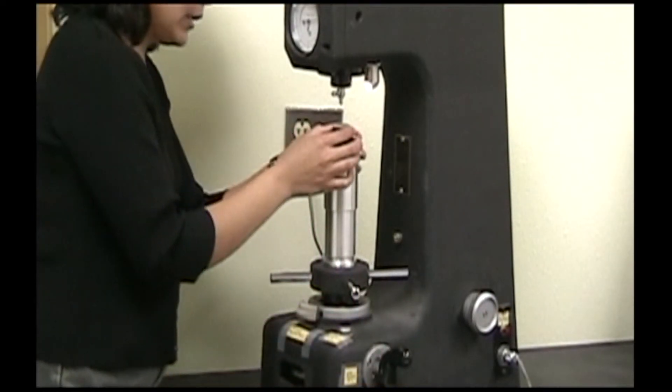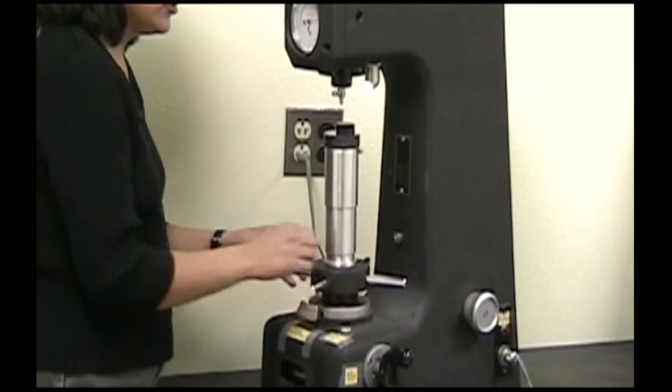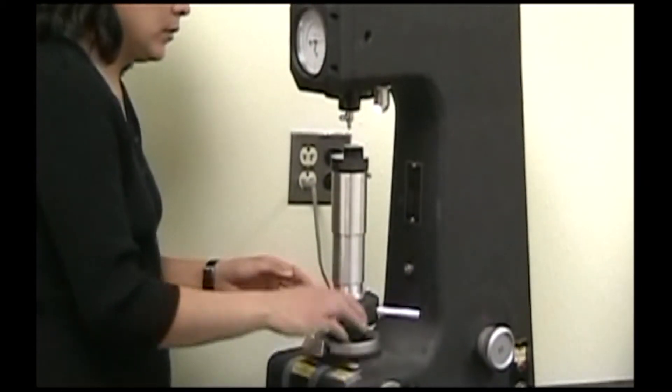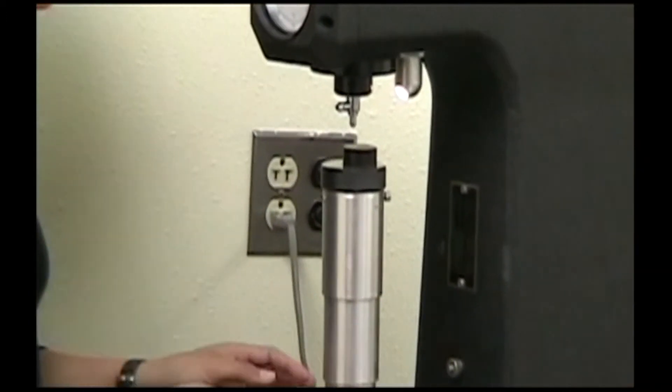You place your sample on the stage and you gently raise your sample until it comes into contact with the indenter.